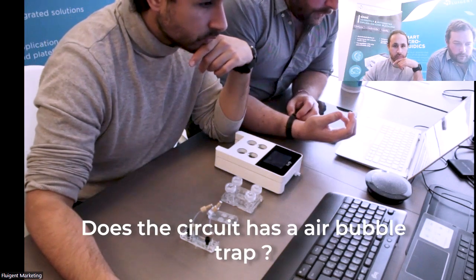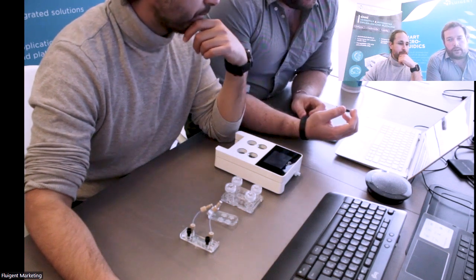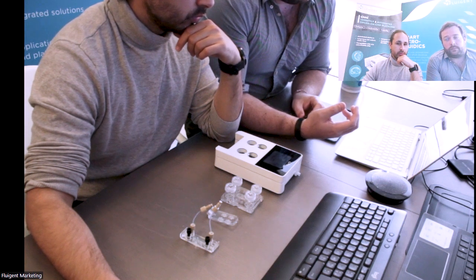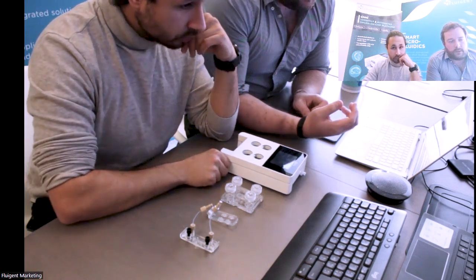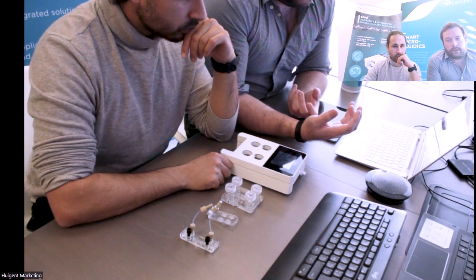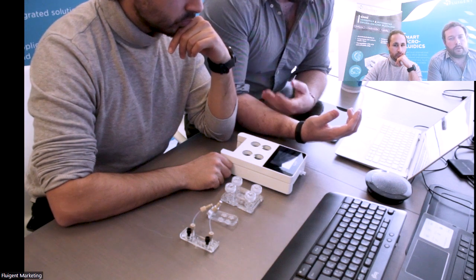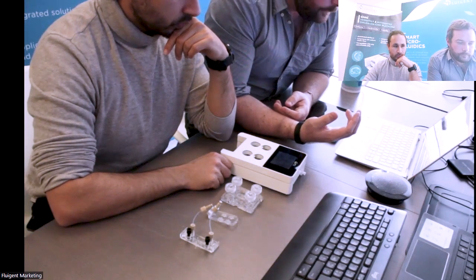There is no bubble trap in the system. You can add it if you want. There exist some bubble traps that you could place between OMI and your chip. But basically, all the security of the system has been thought to prevent air from being mistakenly injected during any steps of perfusion or recirculation.